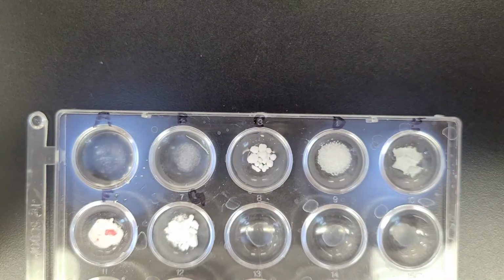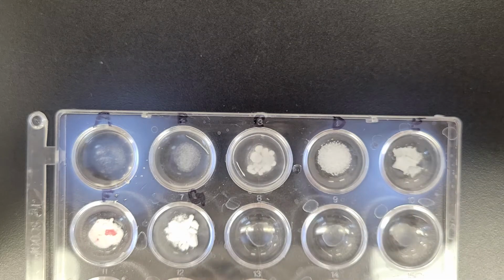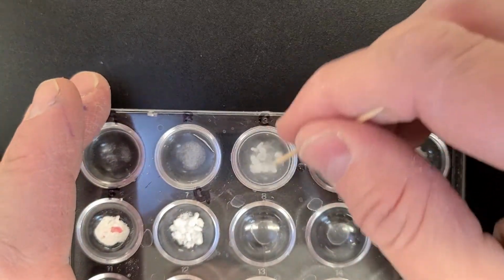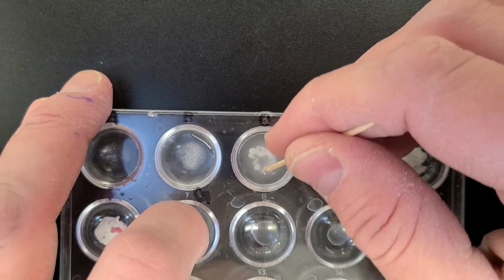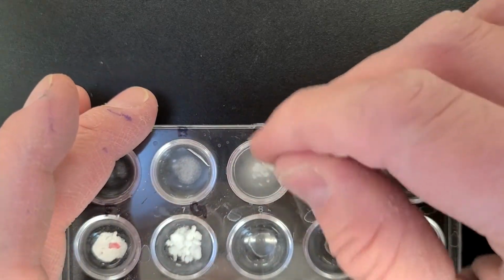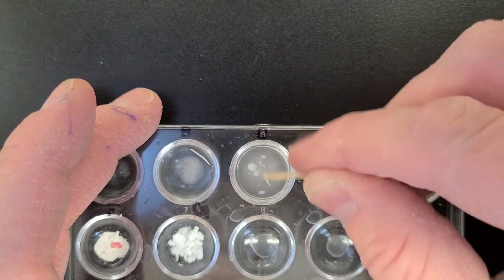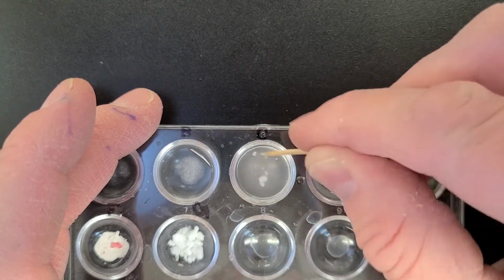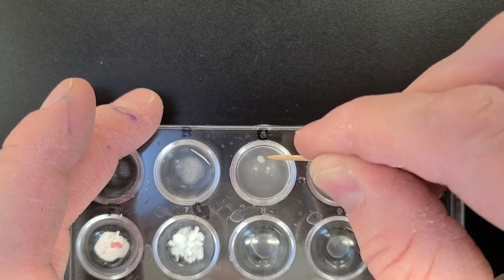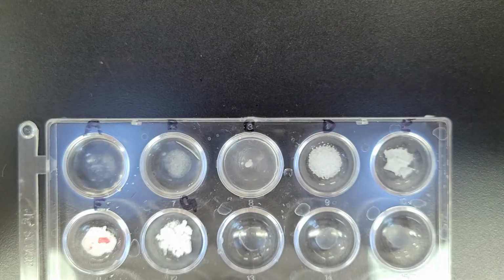Okay, substance C. All right, so look at what's there now. And I'll give it a little mix. Oops, one jumped out of here. Mix this, get rid of the one from here. So you're thinking, of course you have less because one jumped. Oh, look at that. Look at what we have left, one big chunk there. So that kind of gives you an idea. Substance D.